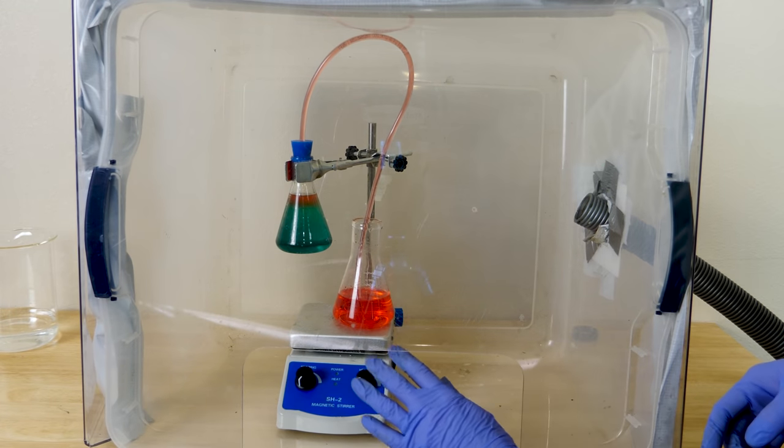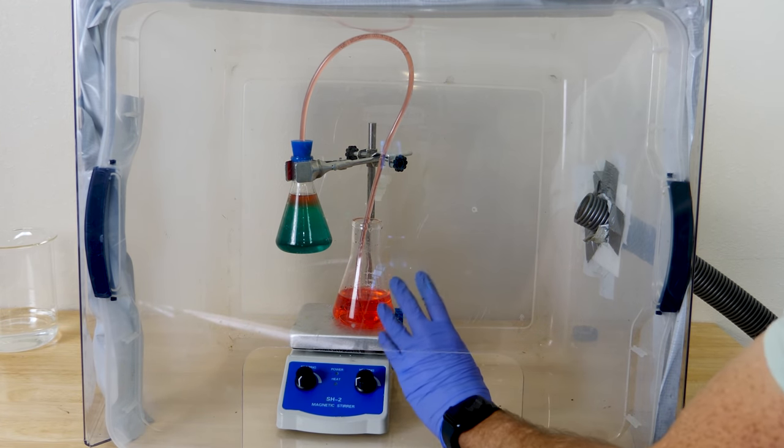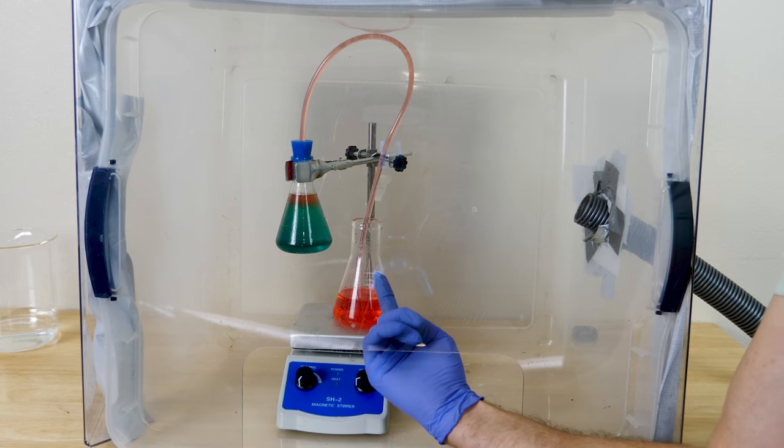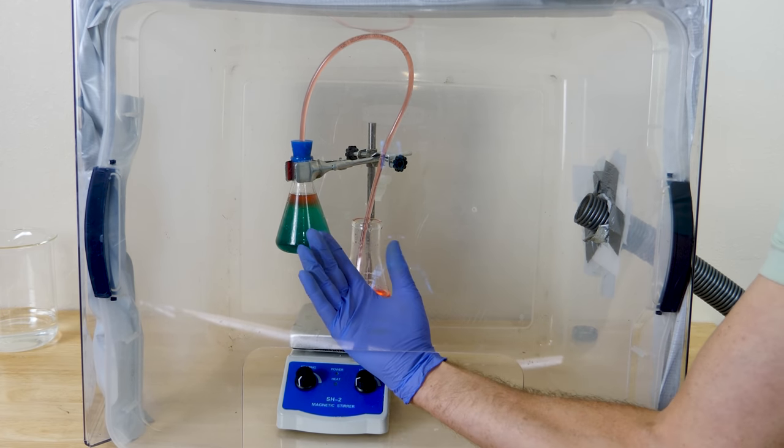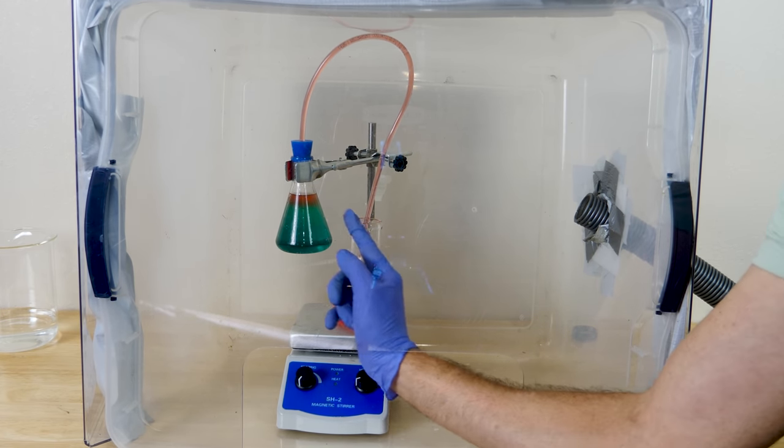Okay, so how did this happen? At first gas was bubbling out really rapidly, but then all of a sudden it sucked it back in and kept sucking it in until it sucked the water from this jar into this one.